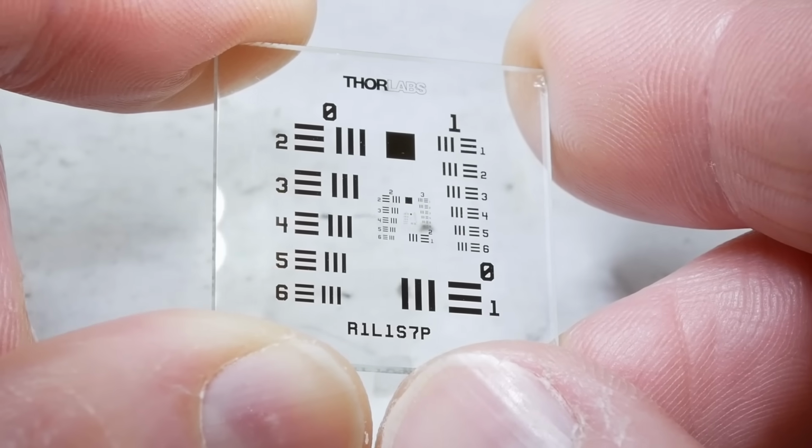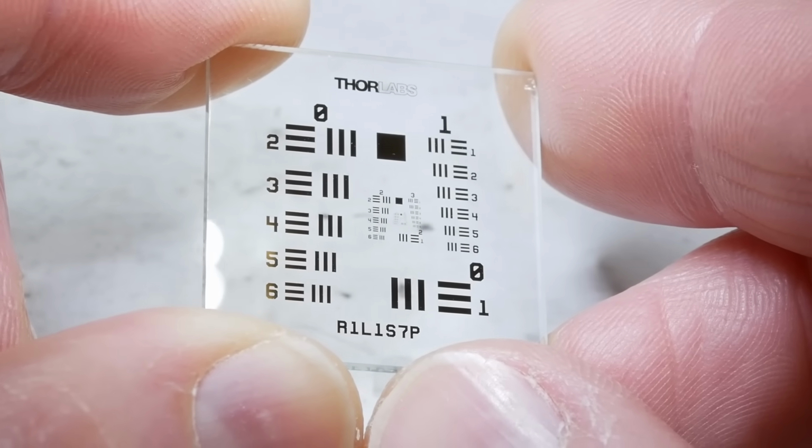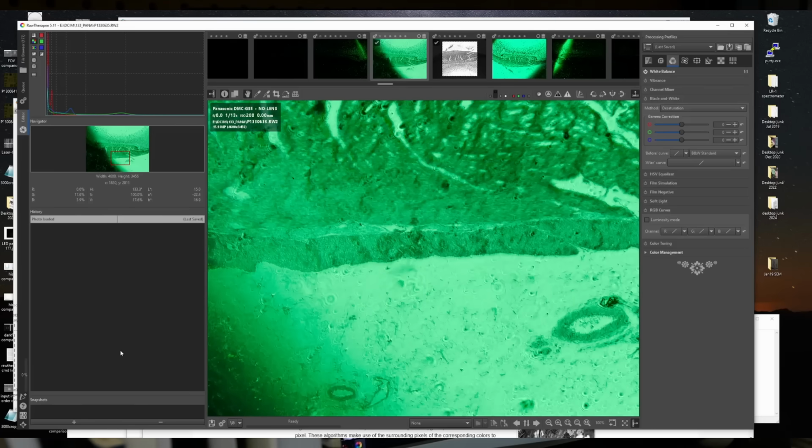If we move to actual images collected with this setup, you can see this working with the Air Force target, the resolution target. If we start off with central illumination, of course that's called bright field because we're looking right at the illumination source. But now if we move the angle of illumination off to the side, you can see each region of the resolution target lighting up in turn as we get into more and more extreme angles and higher spatial frequencies. And so it almost seems so simple that it's never going to work, but really the technique does scale up to very complicated images, and we can extract a huge amount of detail by collecting just a few hundred spatial frequencies. Let's talk about the image processing pipeline.